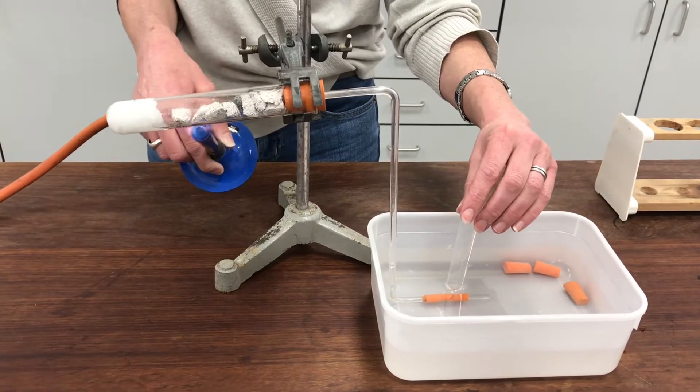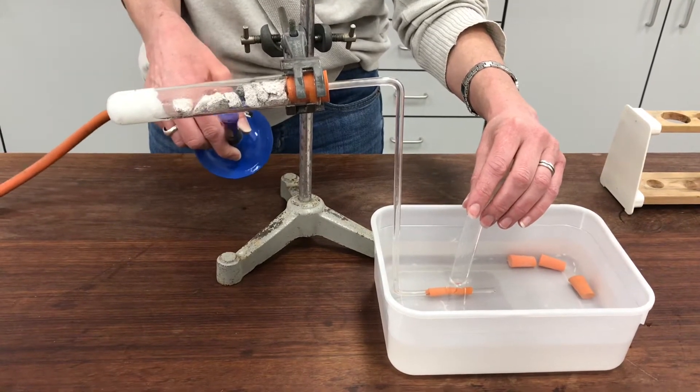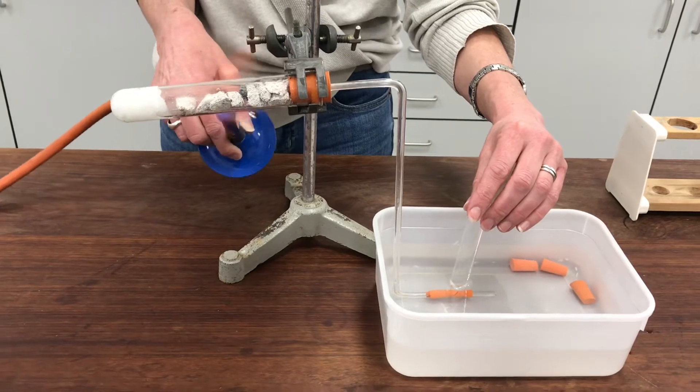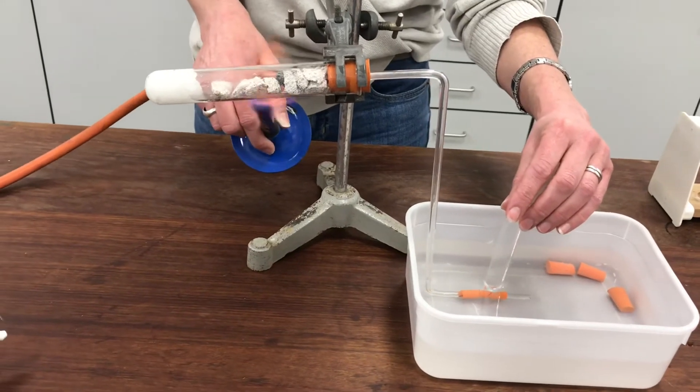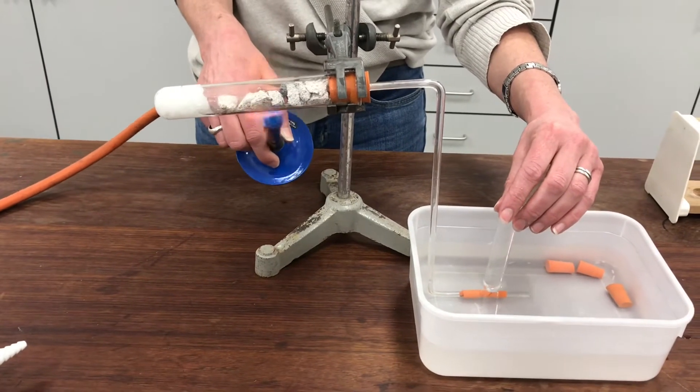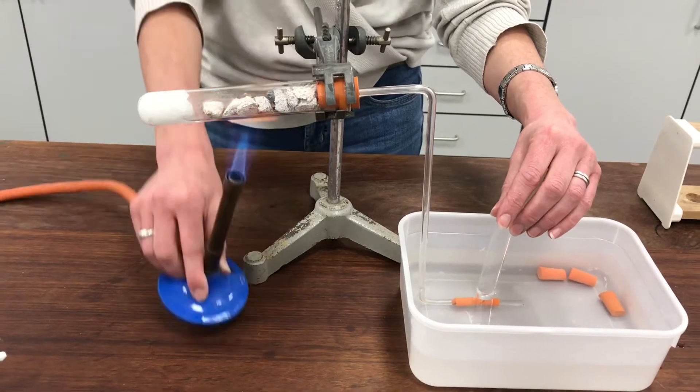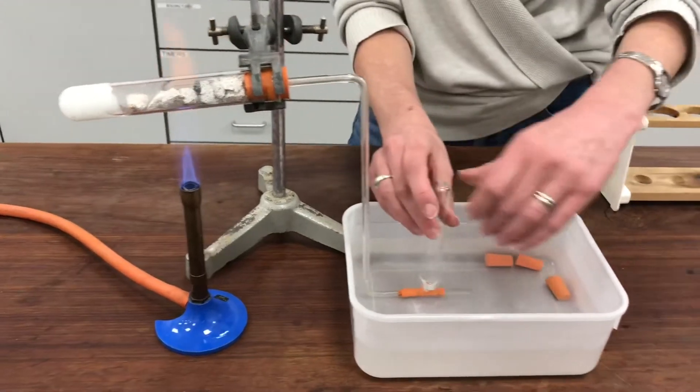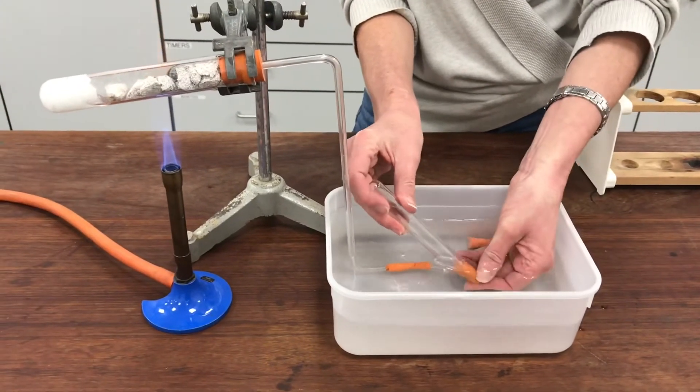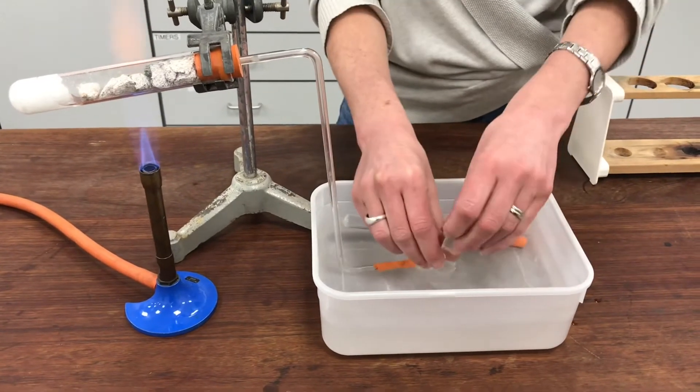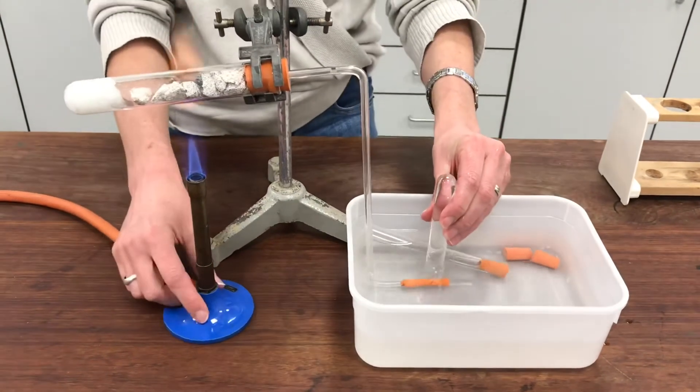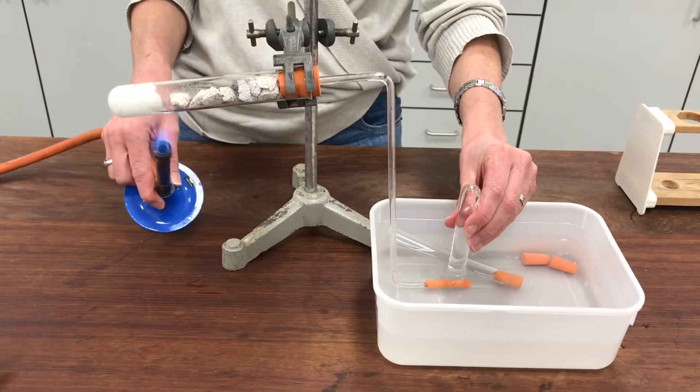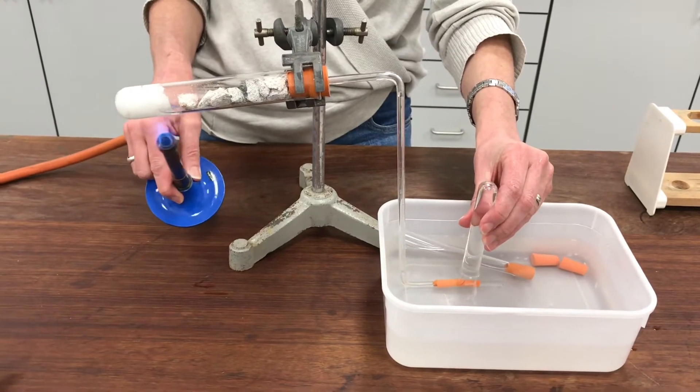OK, I've almost collected one tube of gas now. And this is where it gets tricky because I've got to try to keep heating this tube while putting a bung in my test tube. So let's see how we go. That one's been done successfully. Let's see how many more tubes of gas I can collect. I might join you again in a minute.